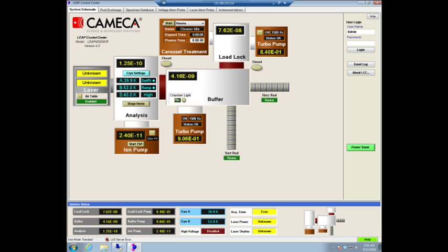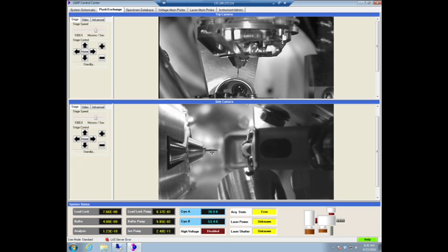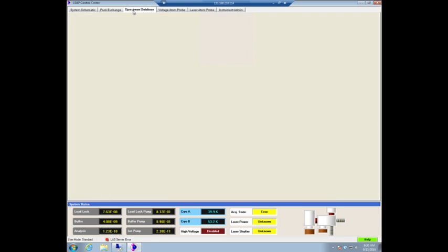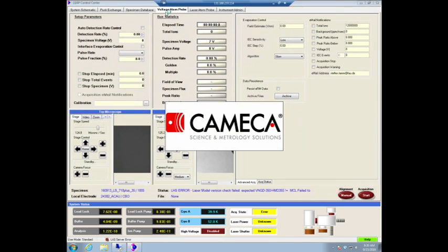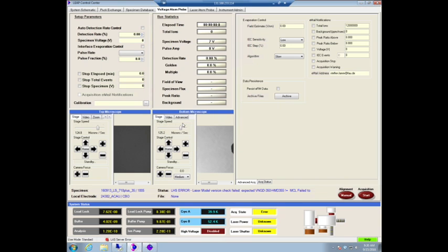We could do a voltage experiment. So here you've got various tabs, and you already saw the system schematic. And the Puck Exchange. So the Puck Exchange is something you need to coarse align your sample and to move it in and out. And the next thing we're going to look at is the tab that you saw before. And now we're going to go to the next tab, which is the voltage atom probe. I don't know what would be running up right now, and it makes me a little bit nervous, but I guess we're going to see.